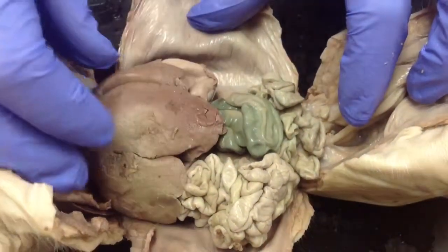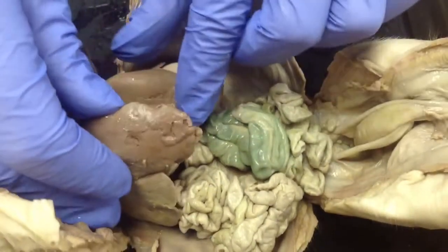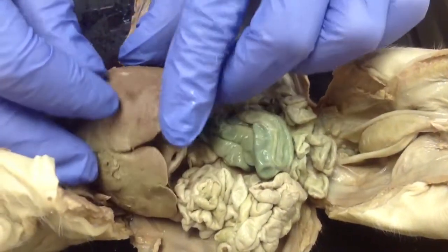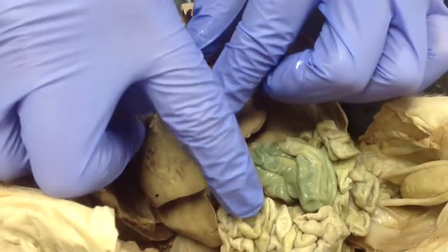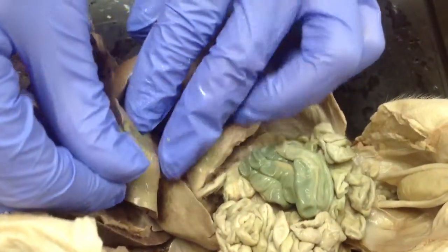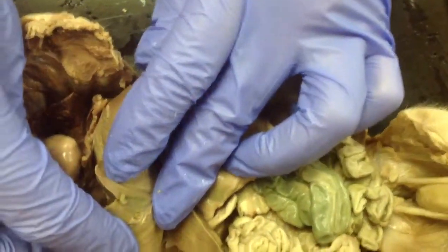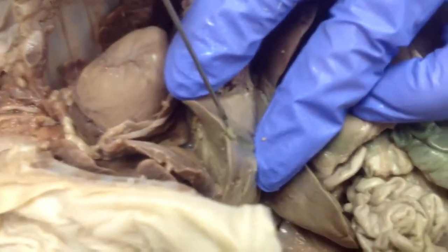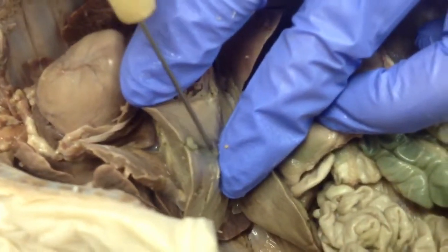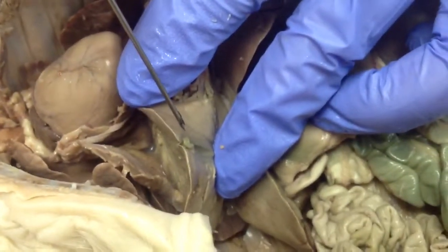First thing you come across are the liver. Okay, there's a few lobes of liver. And if you come right over here to that little notch, and lift it up, right up underneath that. You can kind of see it's a little deflated in this one. This structure right here, all right?